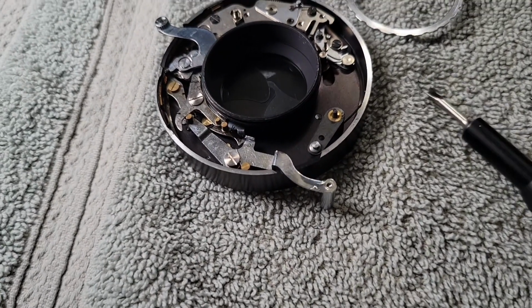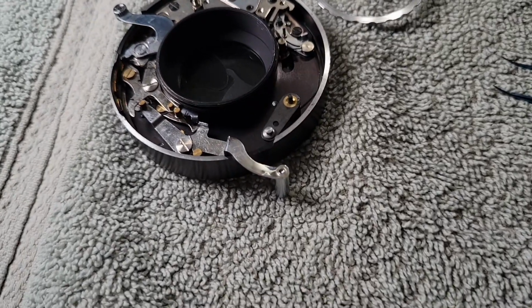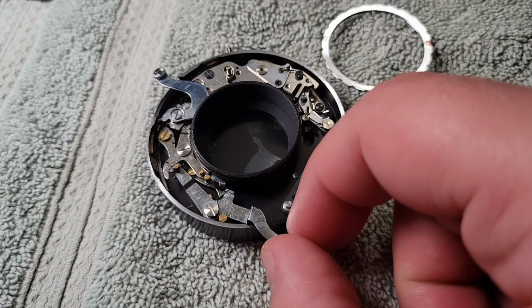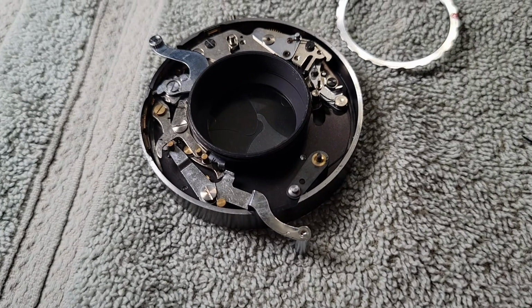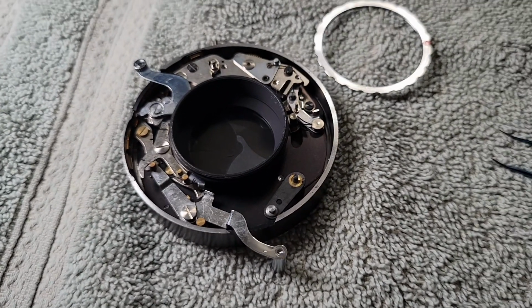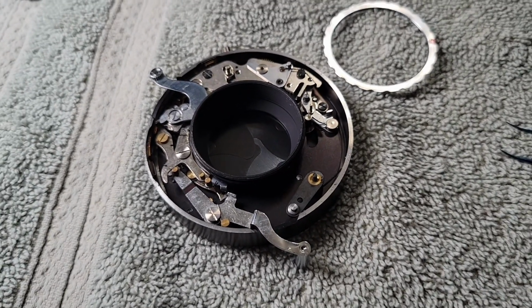A pretty complicated machine to work on. However, it's very, very satisfying to work on. And when it works, that is about the most satisfying mechanism to operate that I've ever seen. It's very fun. Not quite as fun as a fully mechanical 35 millimeter film camera, but pretty close.